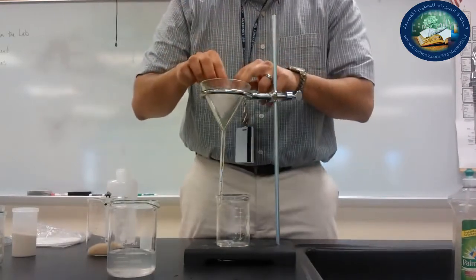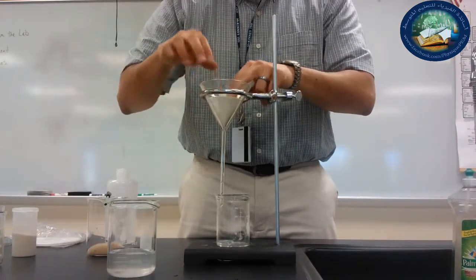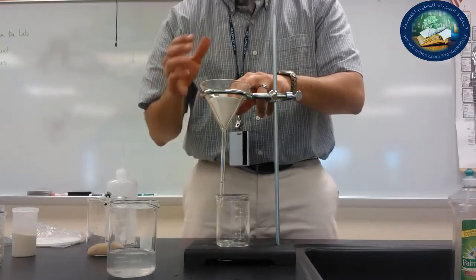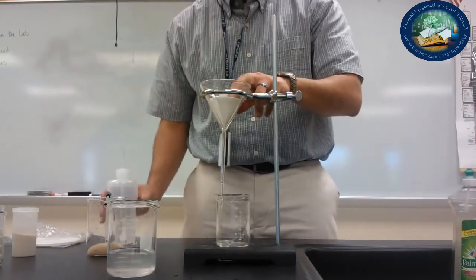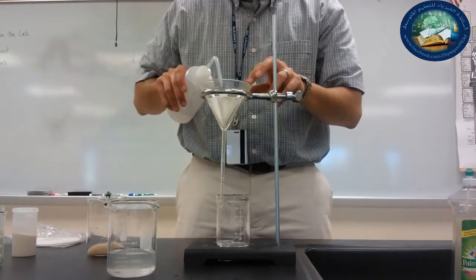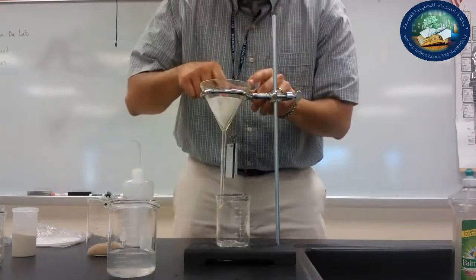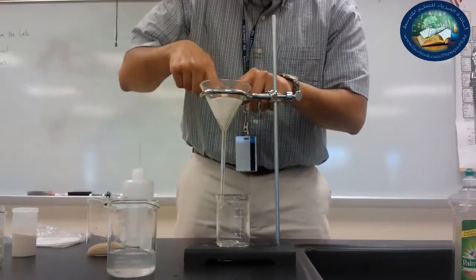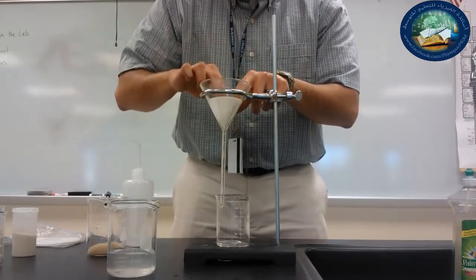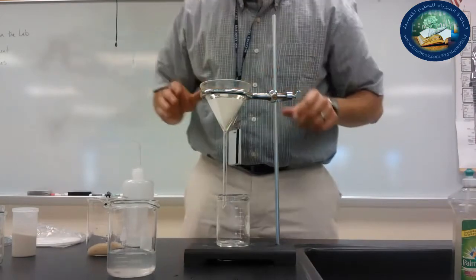Now I'm going to place it in the glass funnel, and I'm going to press it gently against it. I don't want to tear it. And for the filter paper to stick to the funnel, I'm actually going to have to add a little bit of water and wet it. Okay? And that will allow my filter paper to stick against the walls of the funnel. So now I'll just very gently push against it. I want my paper to really stick against the walls, but don't tear it. Be careful not to tear. All right, so there it is.